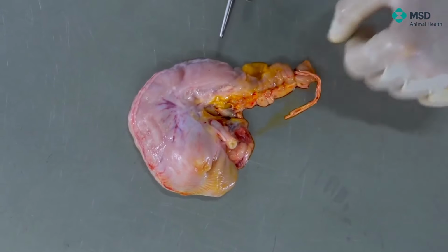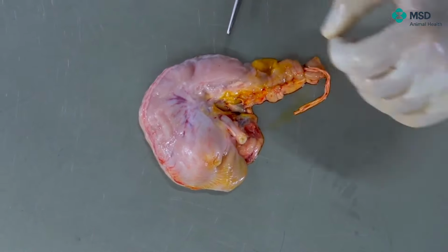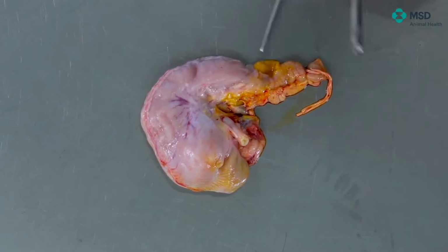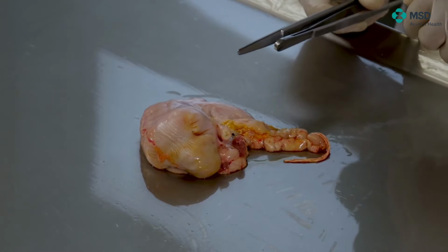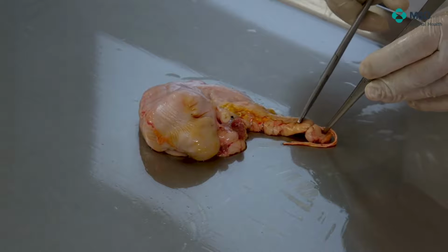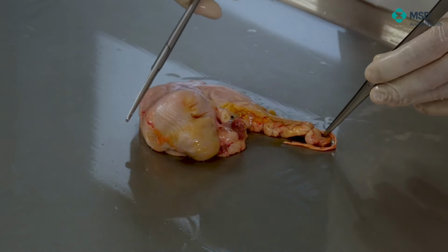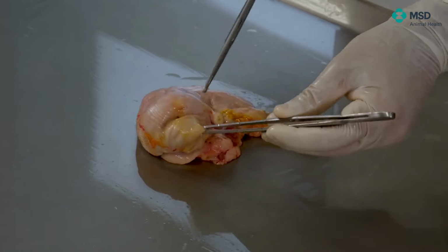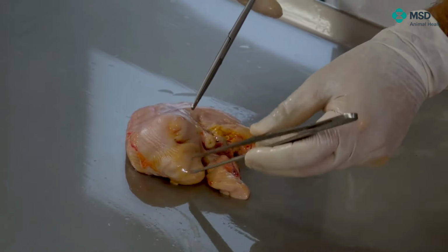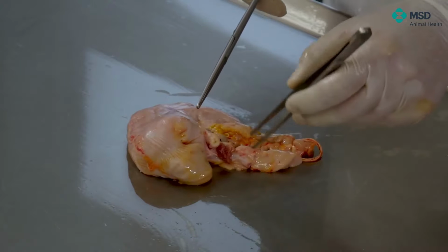So the right way of opening is always from the duodenum following the major curvature until the diverticulum. Remember that the stomach of the pig has a diverticulum here, so we will cut at the diverticulum level. Of content, we will see if there's some liquid. The liquid is of yellowish, greenish color, until here the diverticulum, as I indicated before.